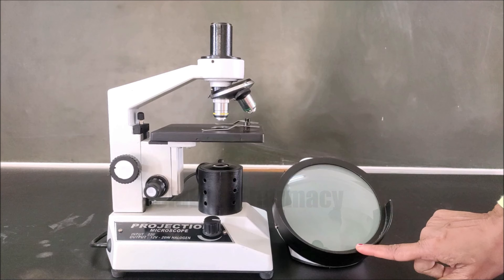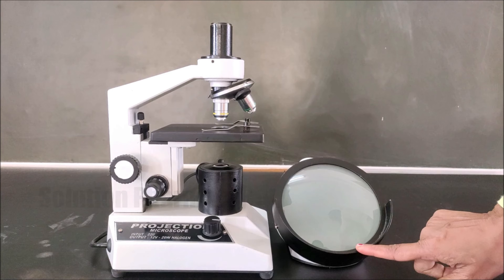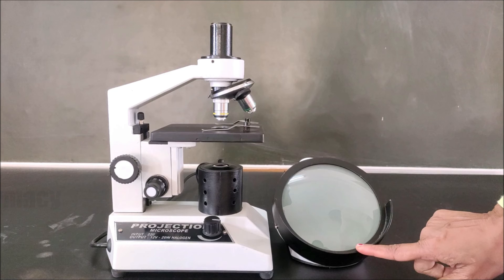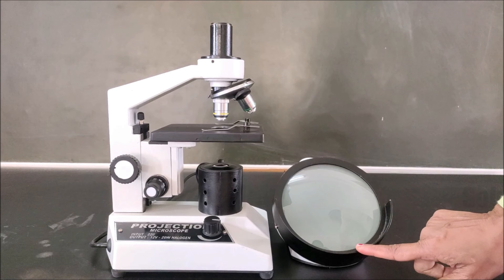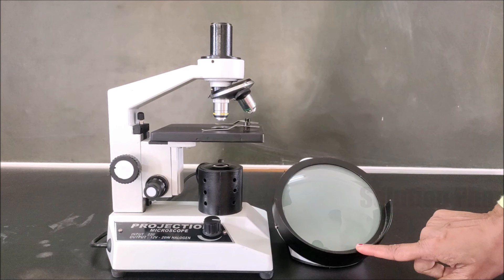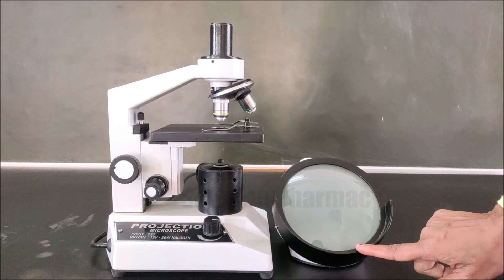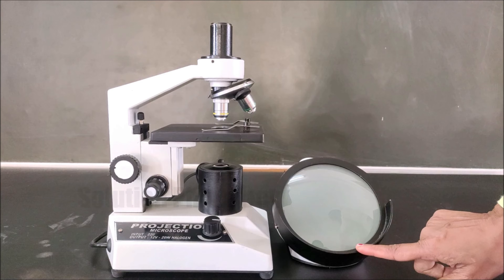First of all, let's know why this type of microscope is called a projection microscope. As the name suggests, in this microscope the image of the specimen is projected directly on the screen. The specimen is the object which we want to observe — its magnified image is viewed through the microscope on the screen. That's why it is called a projection microscope.